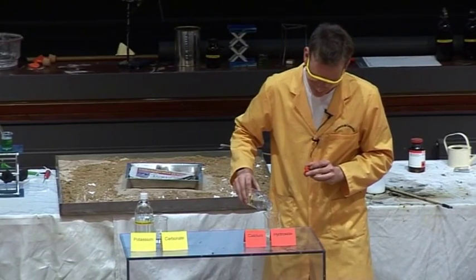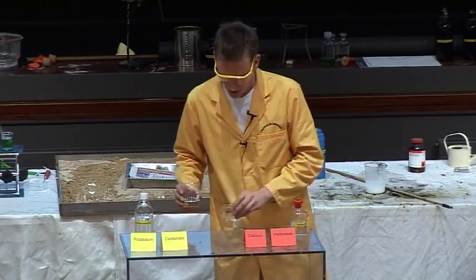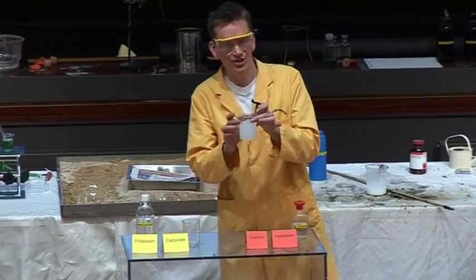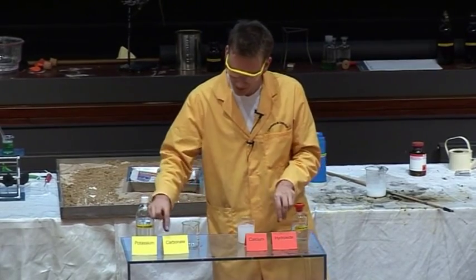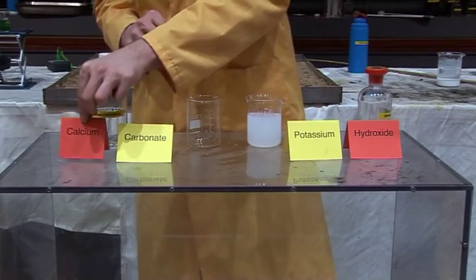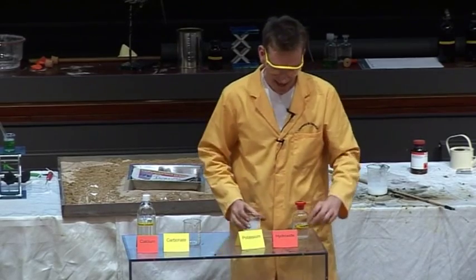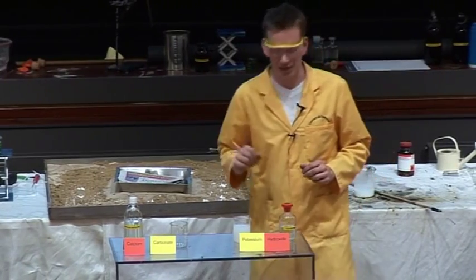We've got calcium oxide, then add water to it, we end up with calcium hydroxide. Here's a solution of that. And the clever thing is, when you mix these two things together, you get a milky colour here. The white colour that you see here is calcium carbonate — it reforms. These things swap round like that, and we end up with calcium carbonate. That's the white colour that you see. And in solution, we have potassium hydroxide. This was called caustic potash.